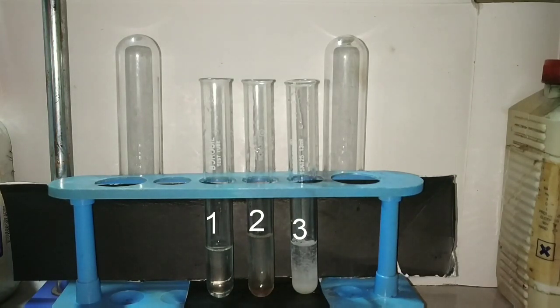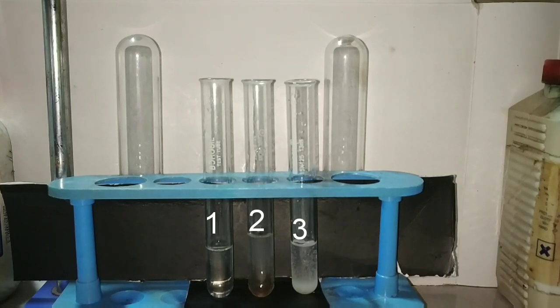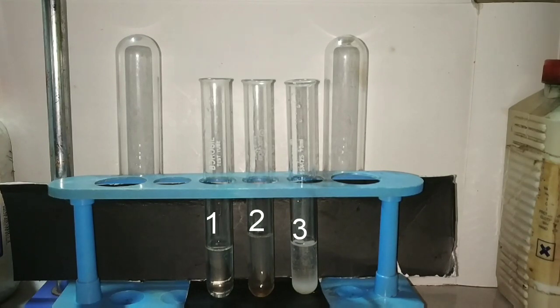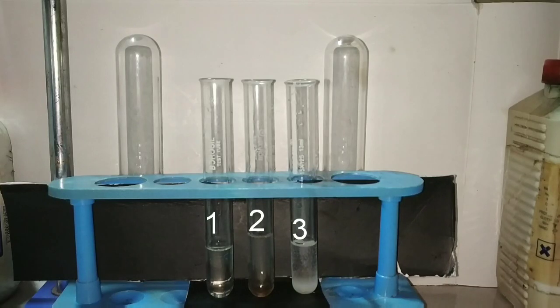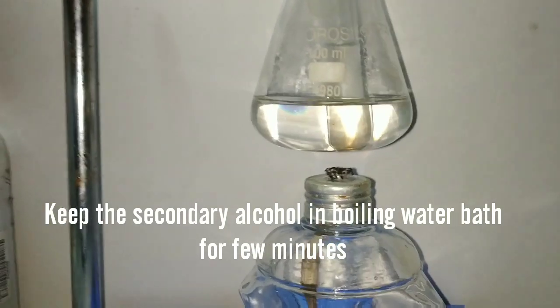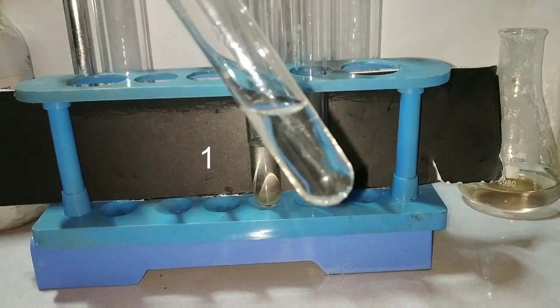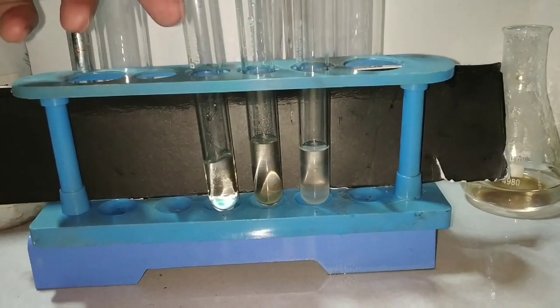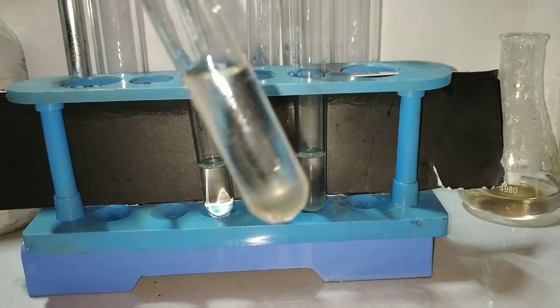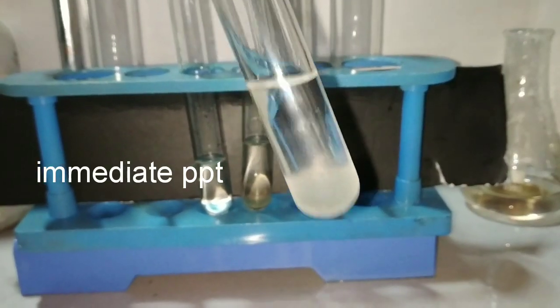Now we will be placing the secondary alcohol in a hot water bath and look for any reaction. Here I am placing the secondary alcohol in a boiling water bath for a few minutes. In the primary alcohol there is still no precipitate formed, but in the secondary alcohol you can see that the precipitate has formed after heating in the water bath. In the tertiary alcohol, the precipitate was already formed.